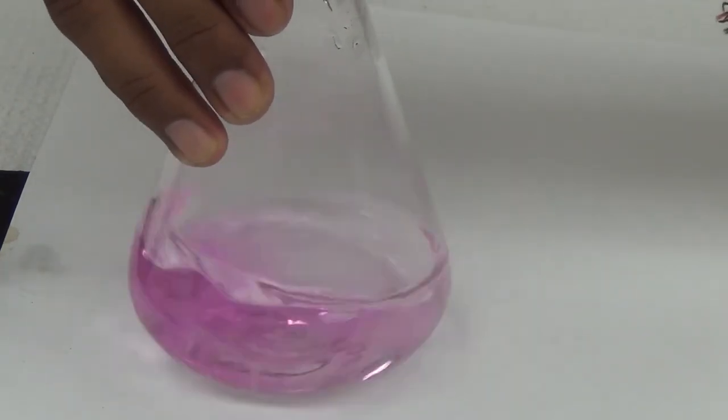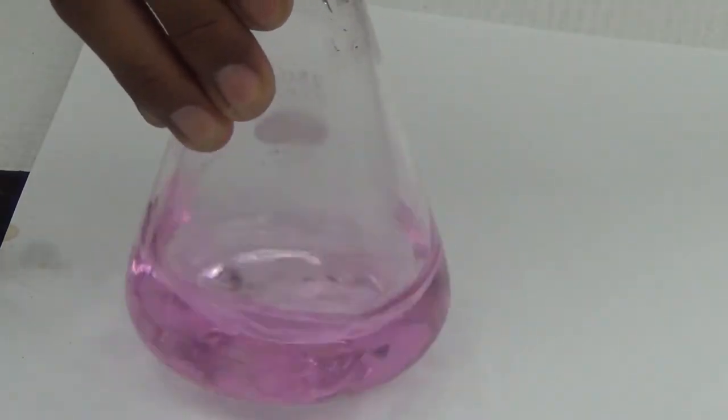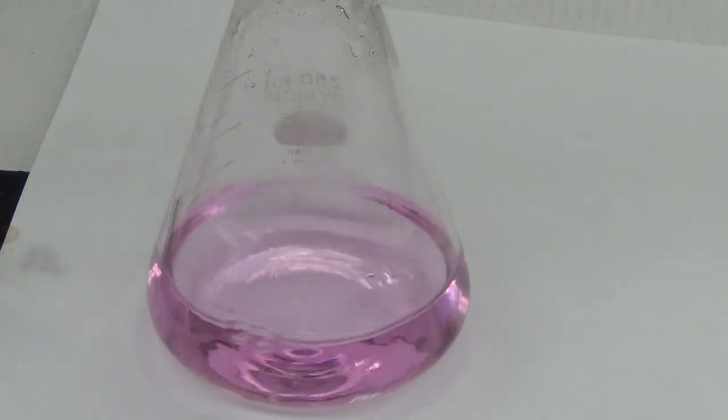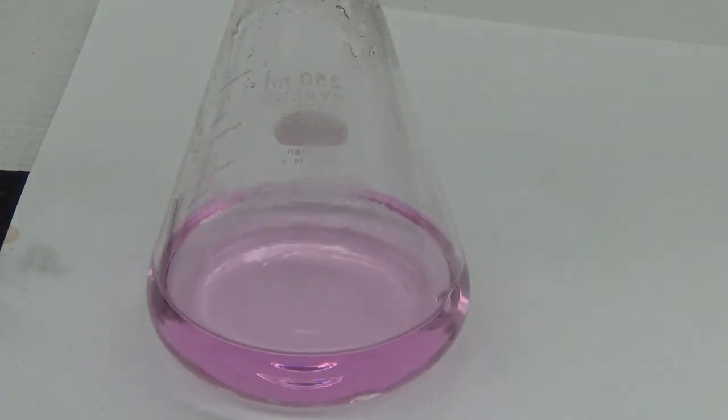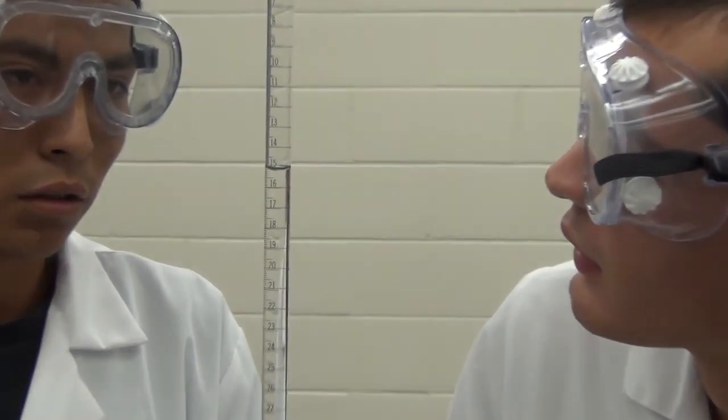Only when the color persists has the endpoint been reached. We'll take another reading at the endpoint, in this case, 14.98 milliliters.